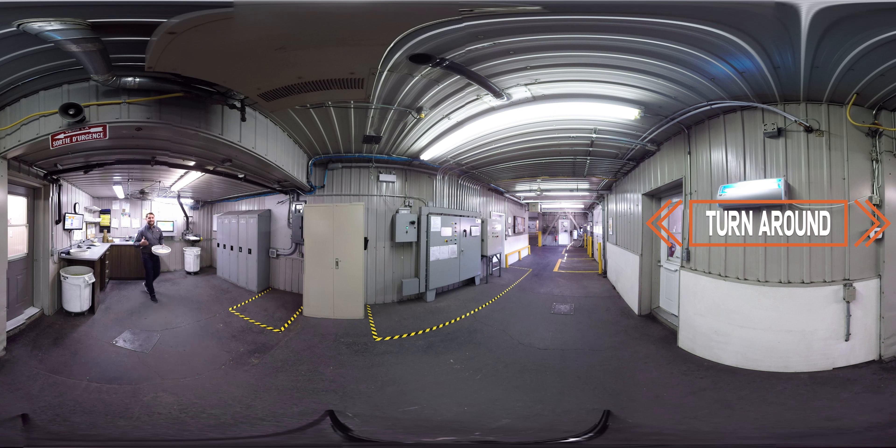The first one is a visual inspection. We want to make sure that there's no difference in color, that there's no stains on the bean, but also that there's no split ends. We also test the level of humidity with this device.